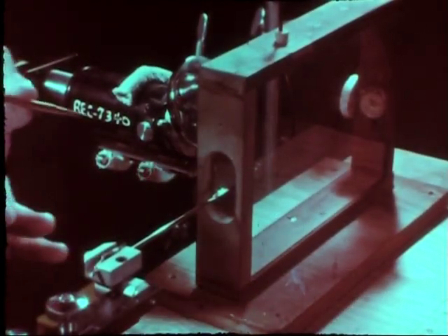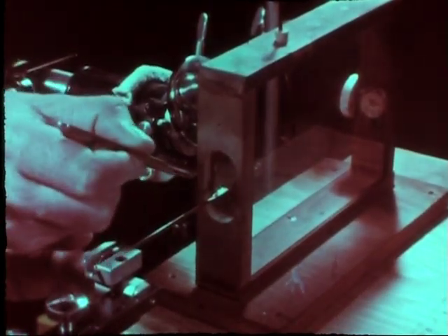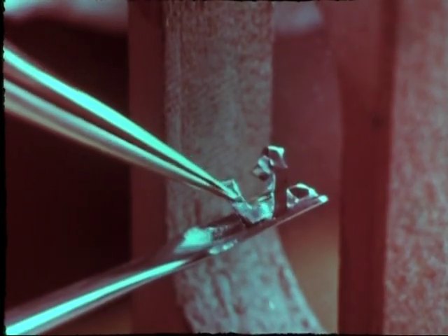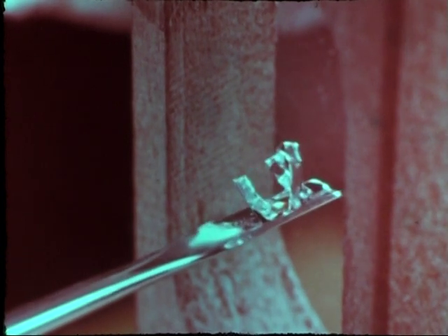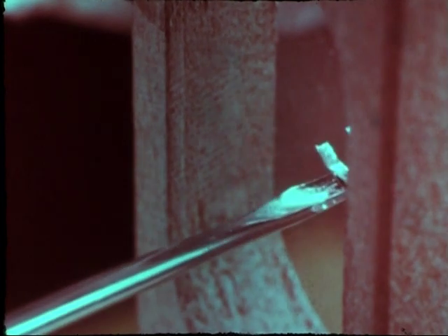The weighing pan, with the almost indiscernible plutonium oxide sample, was then carefully transferred to an aluminum cradle resting on the arm of the micromanipulator.